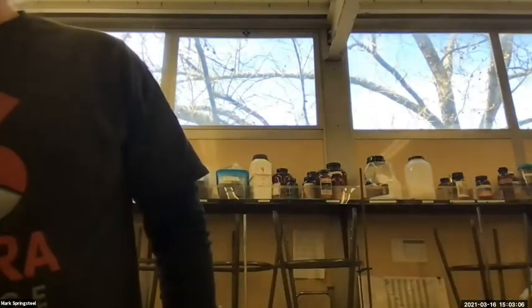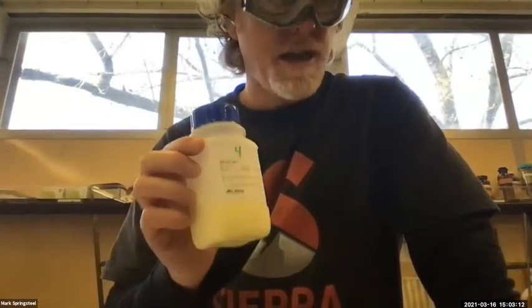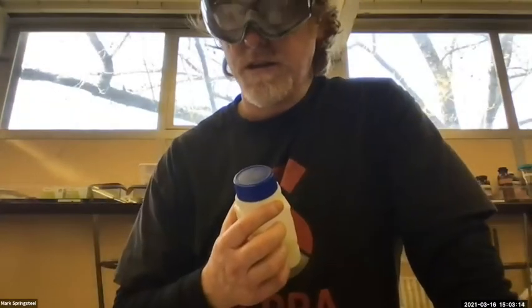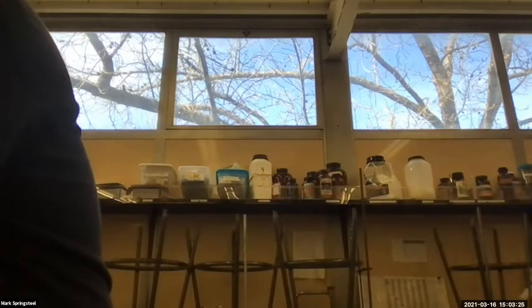So now I'm going to go measure out what I'm going to use for this experiment. I'm going to be using about 50 milligrams of both benzil and the benzocaine. It's over by the scale. I'll weigh it out first on just a piece of scratch paper, and then I'll add it to my centrifuge tube that way. I could have just added it directly to the centrifuge tube when it was dry, but I don't want to do that now that it's wet.